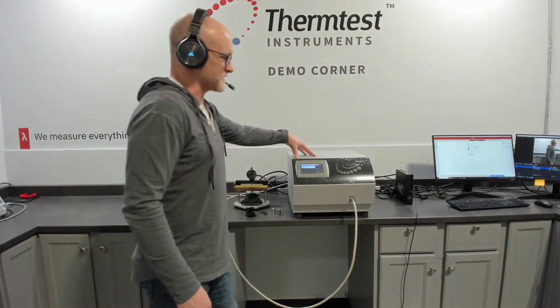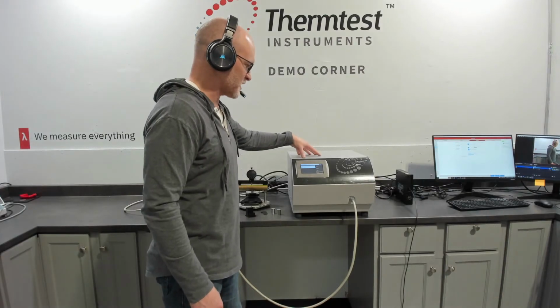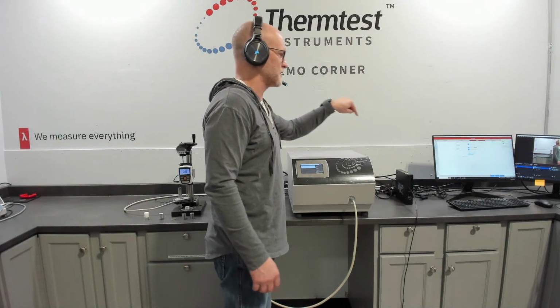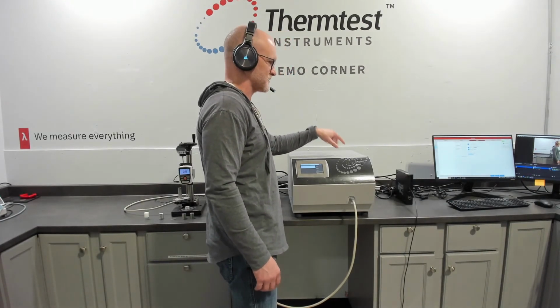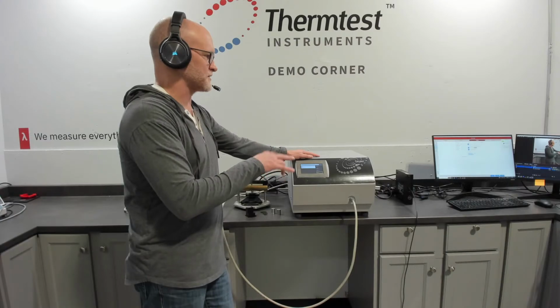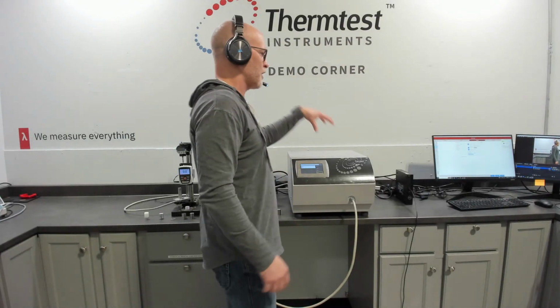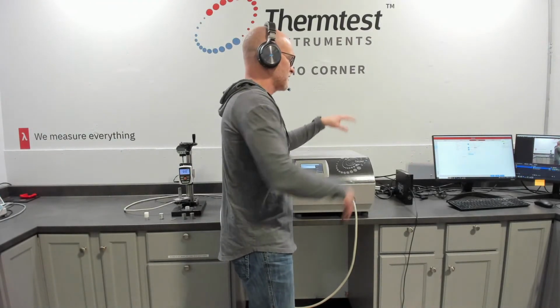So why is that important? It takes advantage of the clever software to automate 1 controller to allow 4 channels to really increase your volume and simplify analysis. So typically, if you look at other instruments that are using an oven, the instrument is locked up until your temperature runs are complete. This allows you to have almost 4 instruments side by side and take advantage of 1 channel doing one thing and allowing the other channel to do another thing.